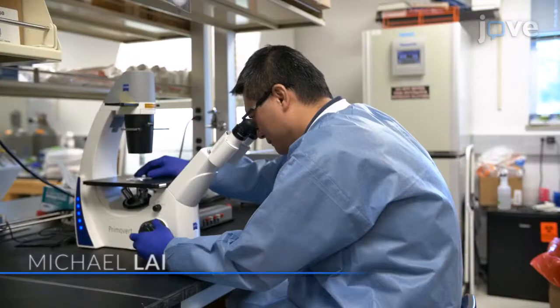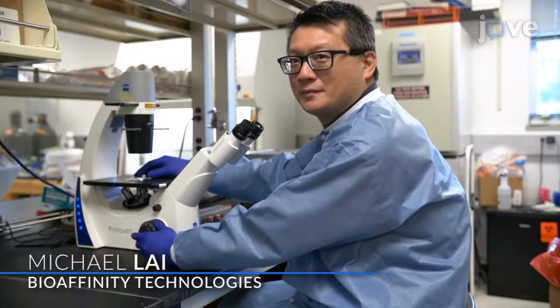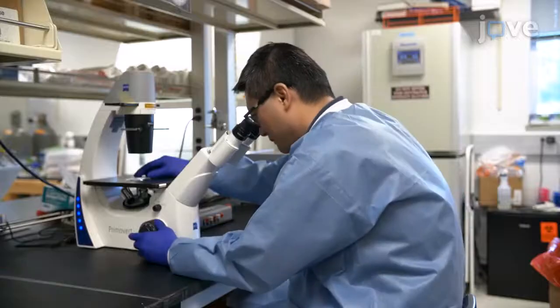Demonstrating the procedure will be Dr. Michael Lai, a research and development scientist from my laboratory.